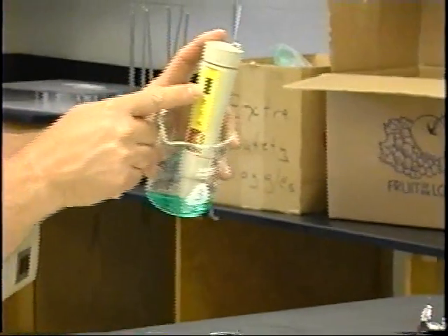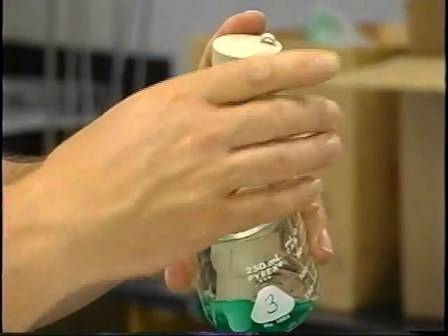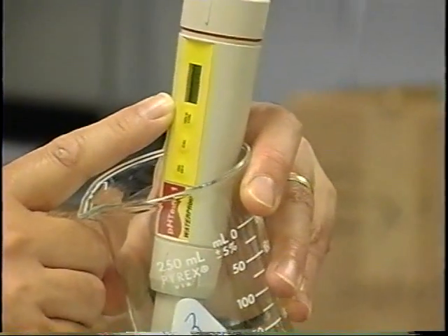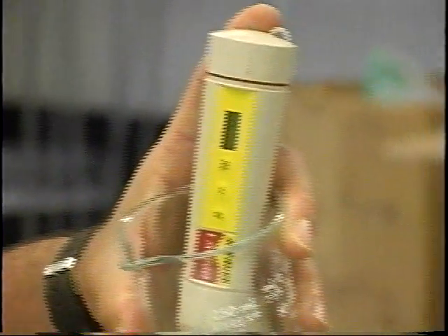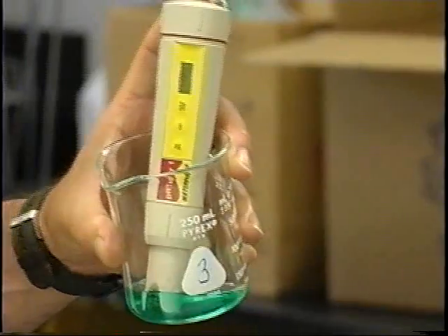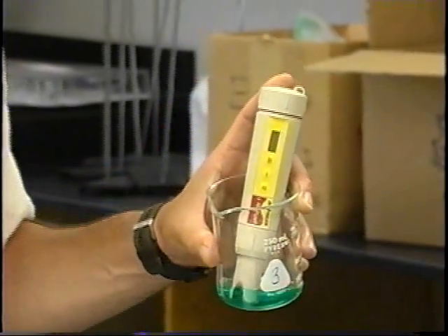And it says the display will flash. And there's a little window in here, and it's flashing right now. Because it's in a 7.0 pH buffer, it's going to probably flash right around that for a while. As a matter of fact, it's calibrating. It's flashing at 7.0 right now. And it says to let it flash for at least 30 seconds or 30 flashes, because it's flashing about once a second.